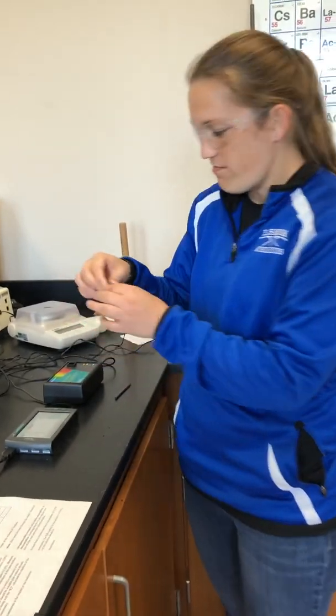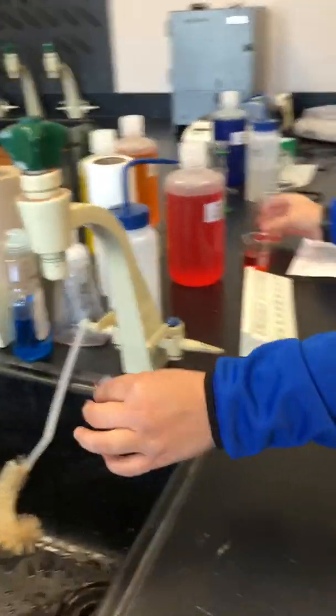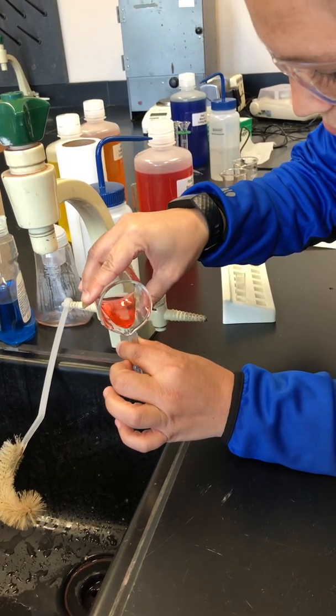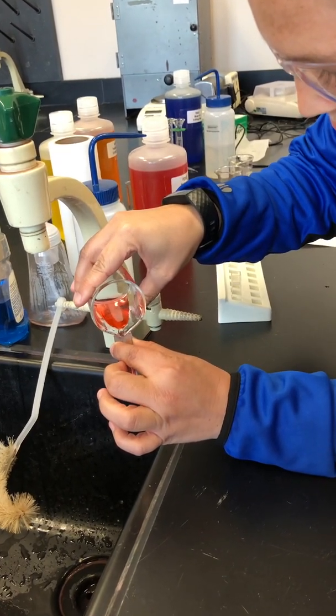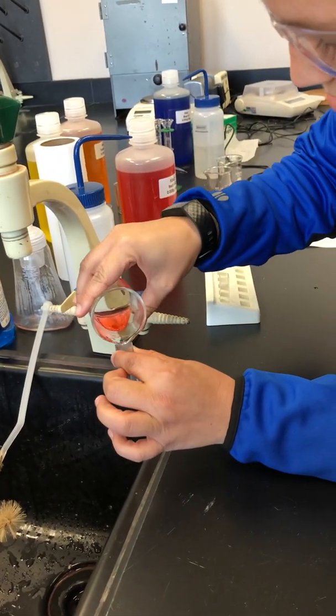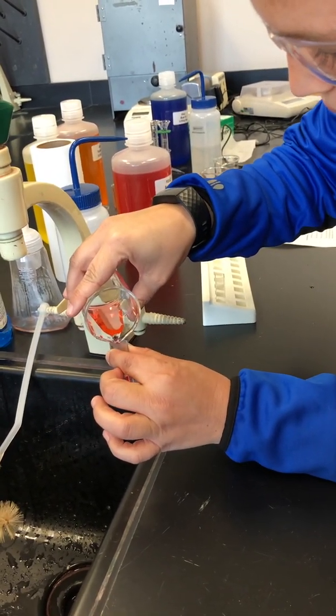All right, so same thing. Take out my 100% sample, dump it. Now we're to the 50%. Pour it in. Rinsing out our samples here.